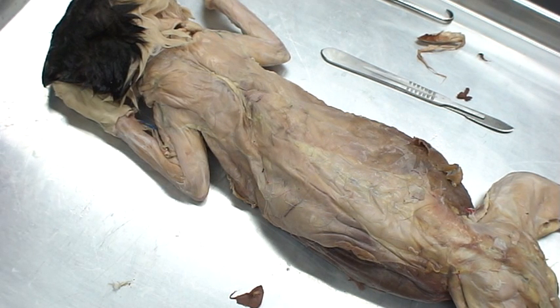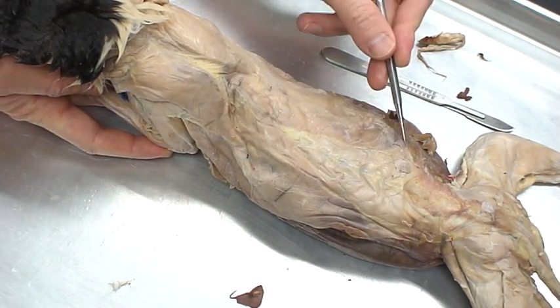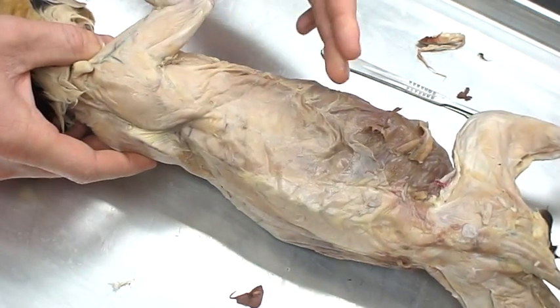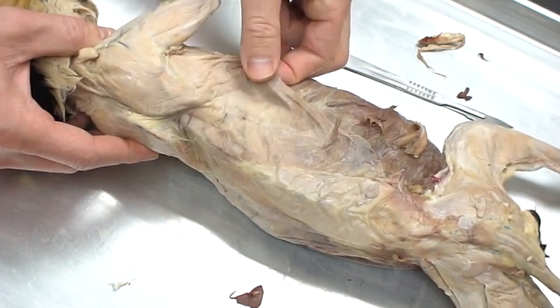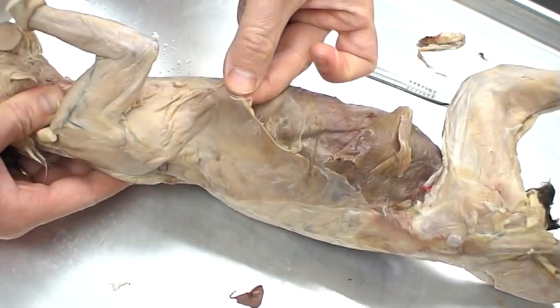When we take a look at the dorsal muscles, we're seeing the back of the cat — this is the dorsal region. What we're going to see are these wing-shaped muscles right here, and these are the latissimus dorsi. We want to be careful when looking at the abdominal muscles because the latissimus dorsi actually forms a flap of tissue that will go over the top of the external obliques, and they'll actually join up with the pectoral muscles as well.